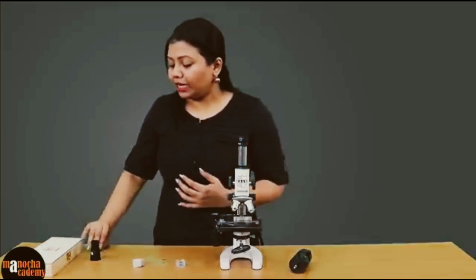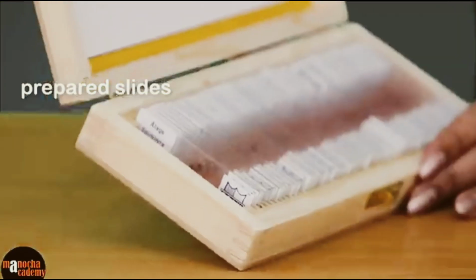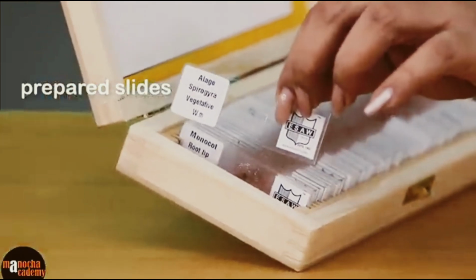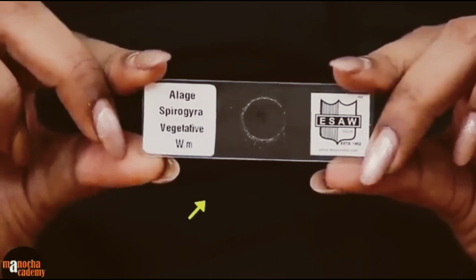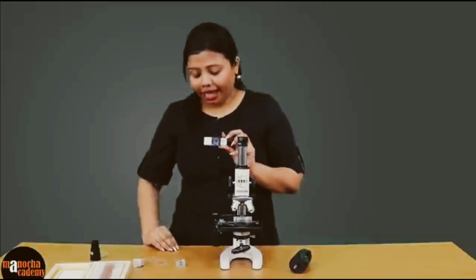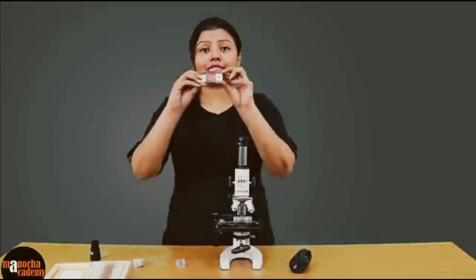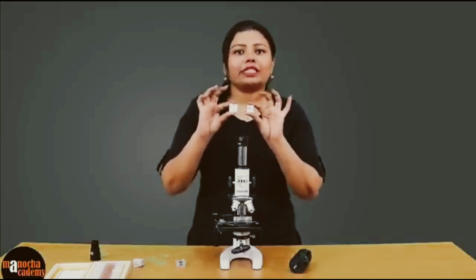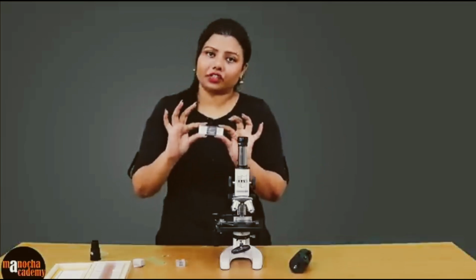For example, we have a large number of prepared slides here. I will show you one of them. So this slide is of the algae Spirogyra. As you can see, there is a cover slip here. In this case, the cover slip is round, but you may also have square cover slips like this, right? So this is a permanent slide which has already been prepared, and this will stay for a very long time. It will not get damaged because it has been preserved that way.